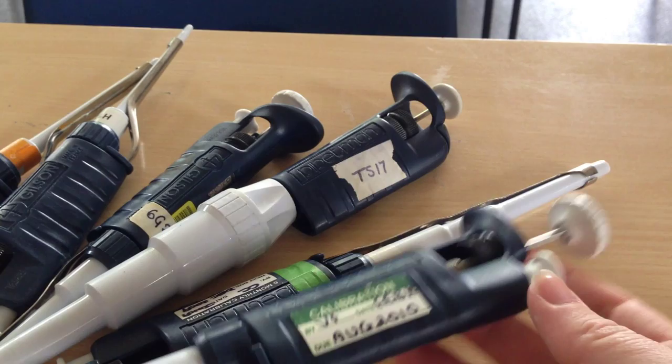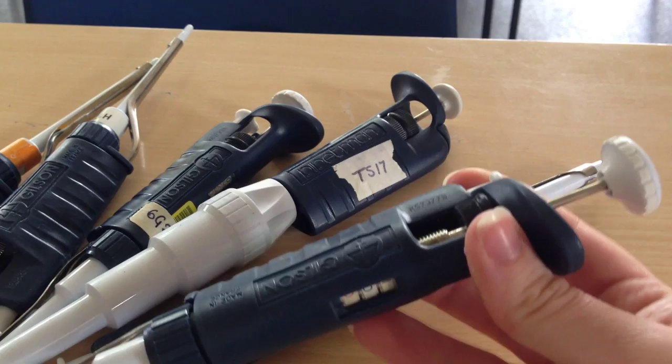Here I'm going to show you how to use Gilson pipettes. These are quite rare in schools. If your school is lucky enough to have them, these are a fantastic resource to use.